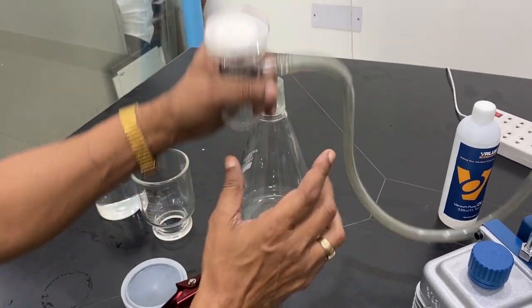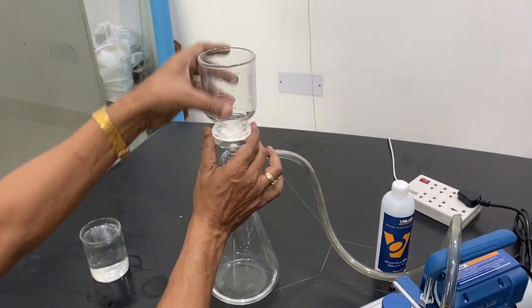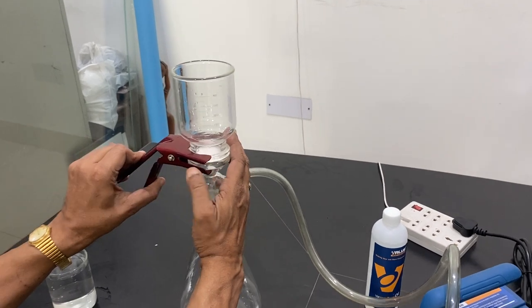So you must use the filter paper — 47 mm — and then put this disc over it. This apparatus has a capacity of about 300 ml. You can see the 300 ml mark, and then you can attach it.